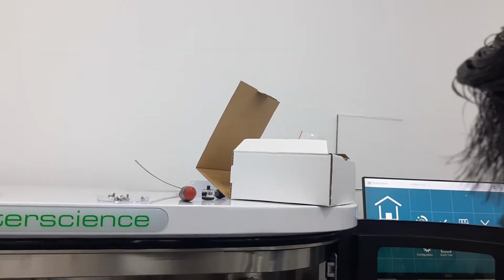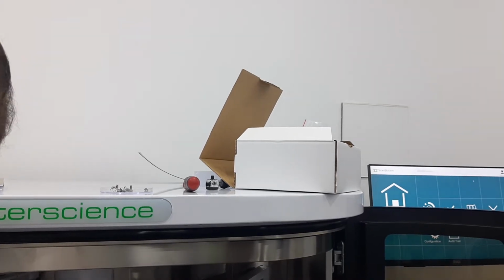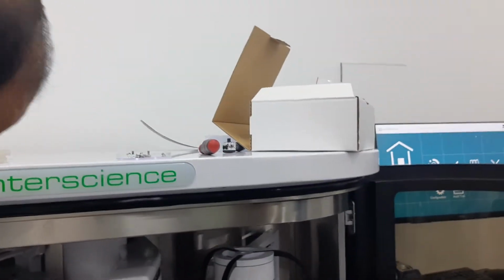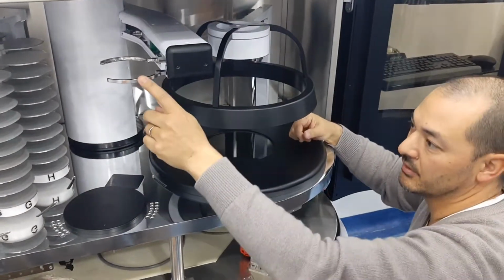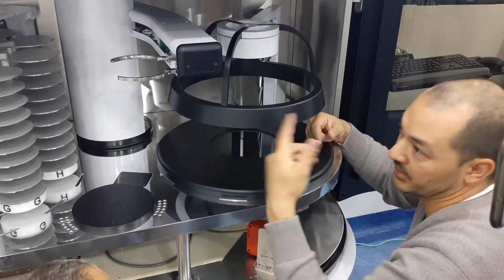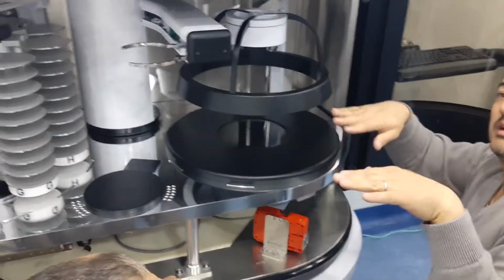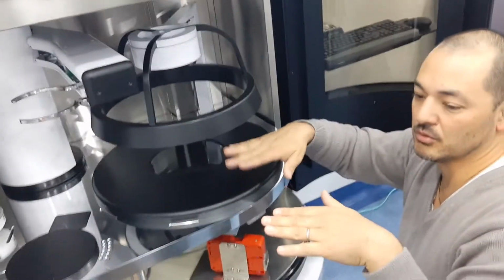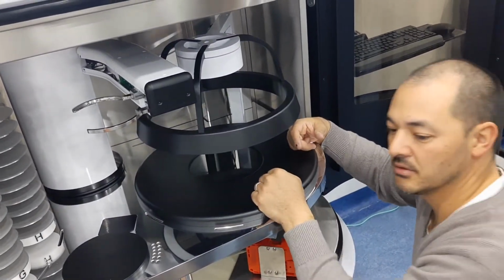Oh, and also you can move it gently from this side. It's possible to lift it, you know, if necessary. Just be careful not to touch it here. And just to let you know, the worst that can happen is that there's a problem with the robot, and this goes and smashes in that, and maybe this goes bent, and that too. So in that case, these ones, the positioning is very precise. Maybe plus or minus 0.203 millimeters. So if ever it's bent, forget about it. Have to change it.